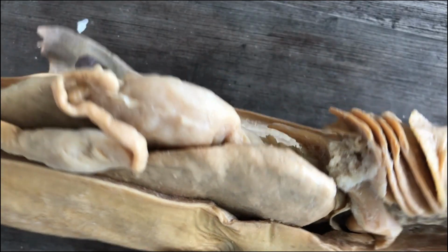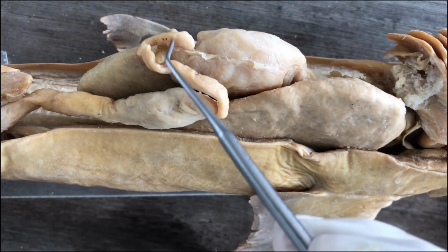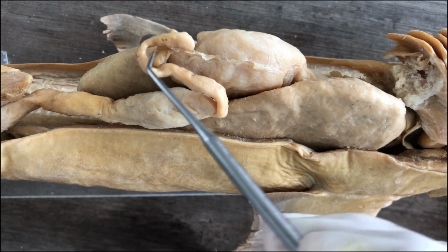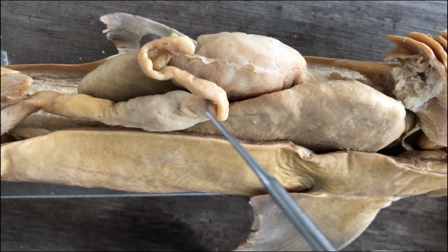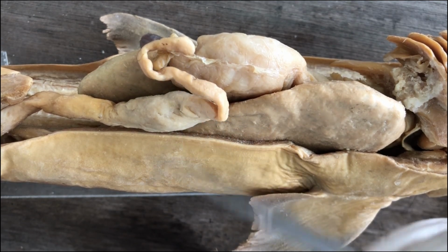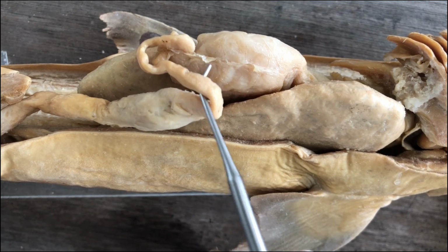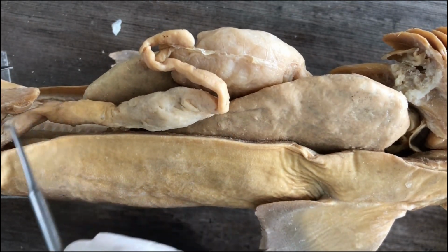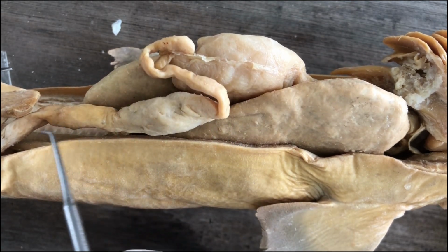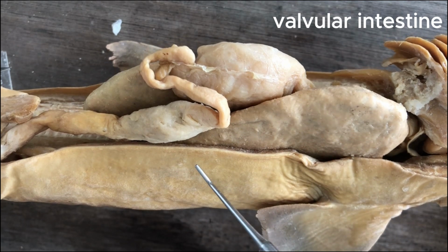is the small intestine. In the shark, the small intestine is divided into two portions. The anteriormost, this one, the thinner one, is called the duodenum. This is the portion of the small intestine where the secretions of the liver and the pancreas are emptied, the duodenum. And as you can see, it enlarges into this structure. This is still part of the small intestine, but it's called the valvular intestine.